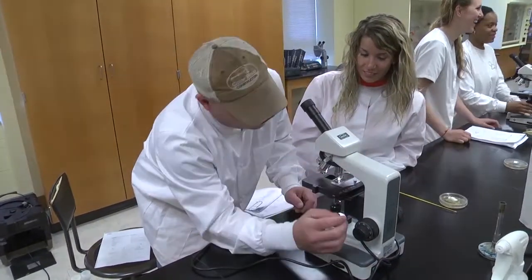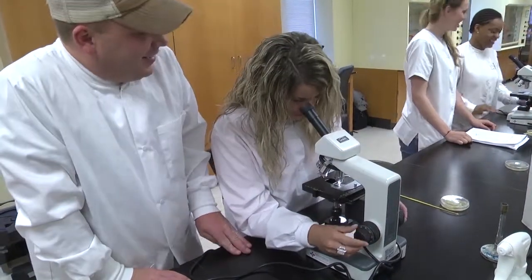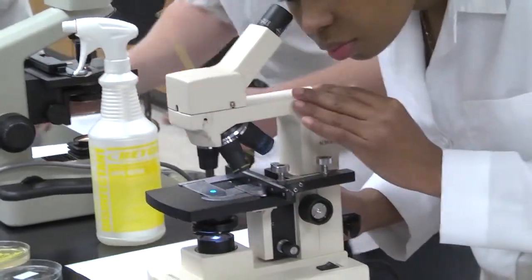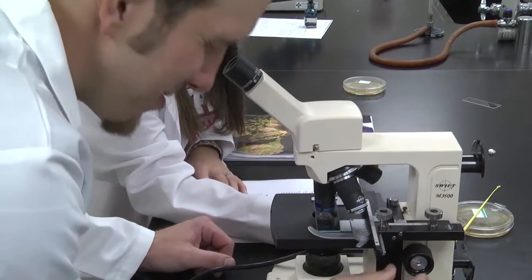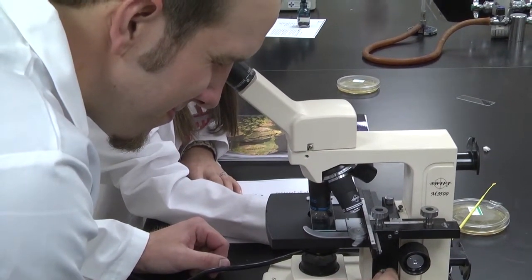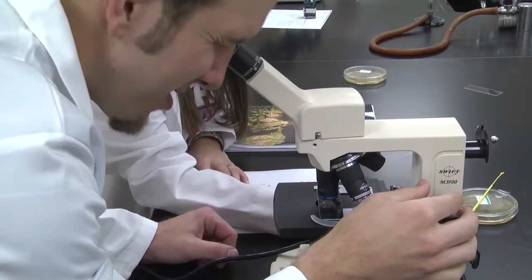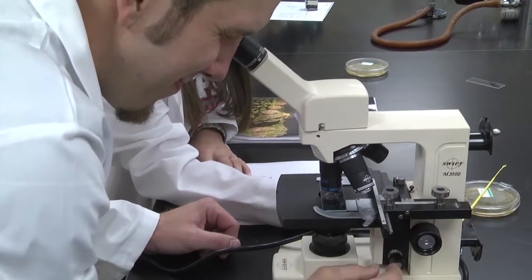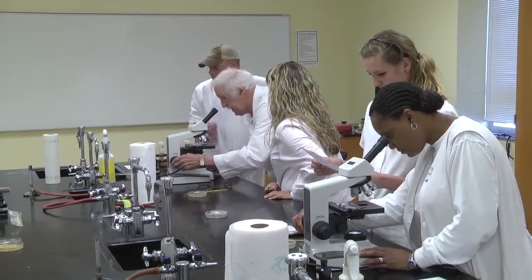But in order to actually see the capsules, to see the halo, we use the nigrosin, or we can use Congo red dye, something that will not penetrate the cell. This is something you can do with an inexpensive microscope and quickly determine the shape and the arrangement of the bacteria. India ink works real well with this. We use nigrosin, but they're acidic stains. With the other stains, we use a basic stain. With a capsule stain, we'd carry this a little bit further, but it's still a very simple procedure.